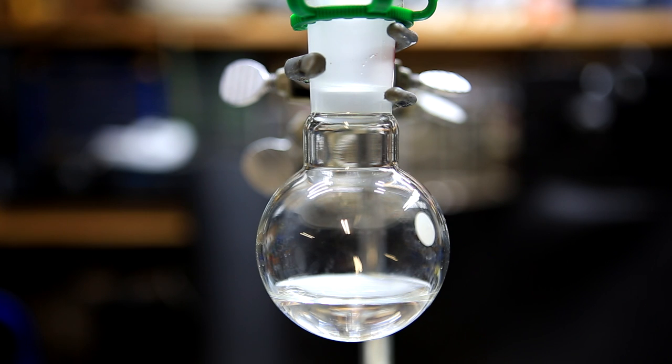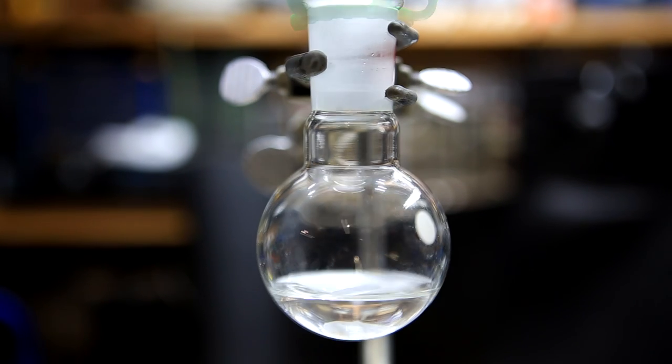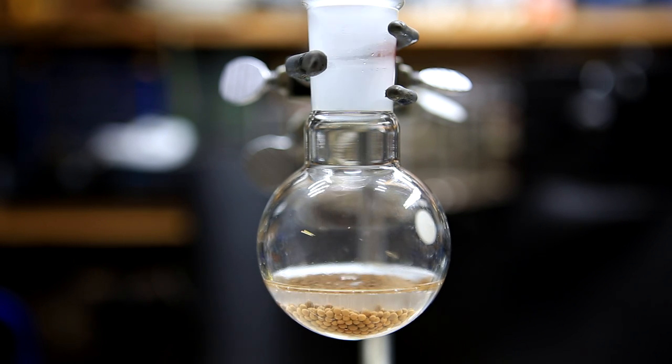Afterwards, we're finally left with a beautiful small yield of stinky propionaldehyde. Just to remove any possible water, some activated sieves are added.